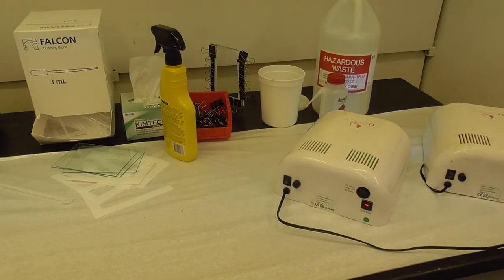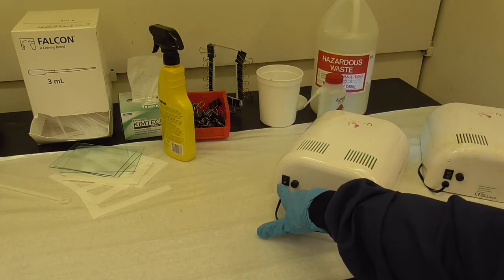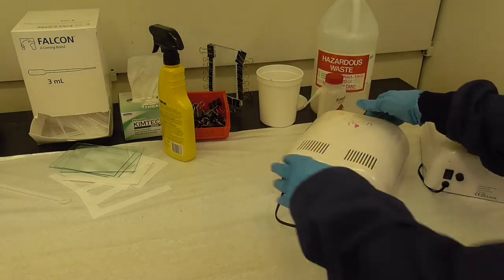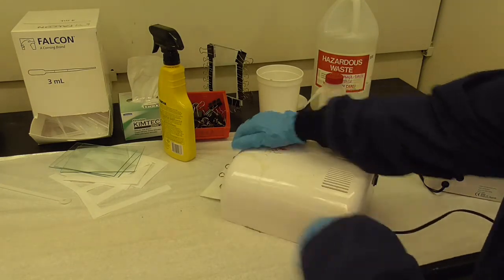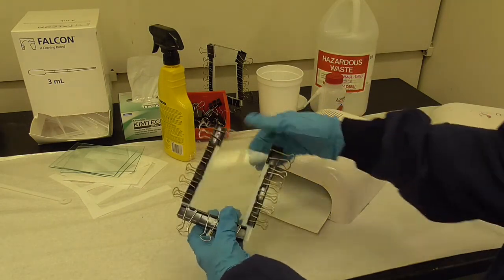After 20 minutes to stop the UV lamp you actually have to turn it off at the off button here. That will turn off the lamp and we can turn this around then and check our polymer film.